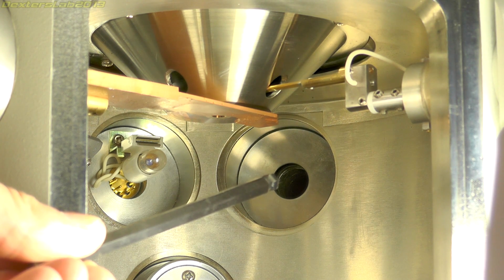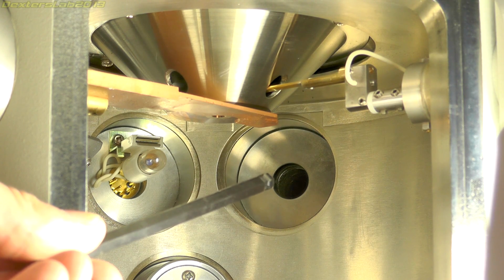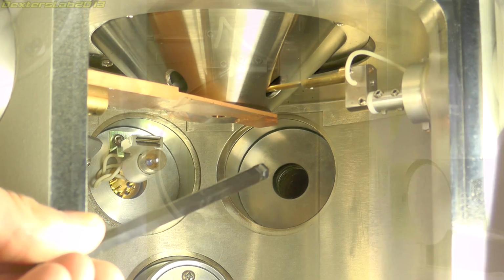Or if anybody has any idea why the ion pumps have a separate feed up to them, can you leave those in the comments, because I have no idea. The ion pumps do seem to be separate in terms of the vacuum from the rest of the system, so I'm not quite sure why or how that is possible, but if anybody knows, please let me know.